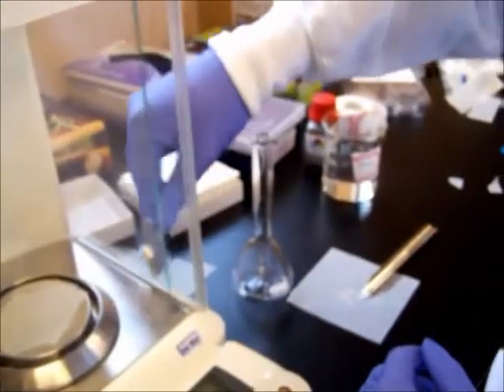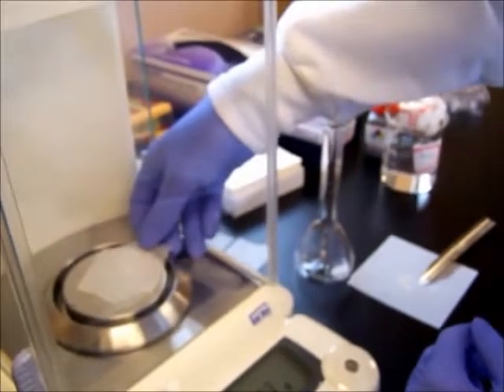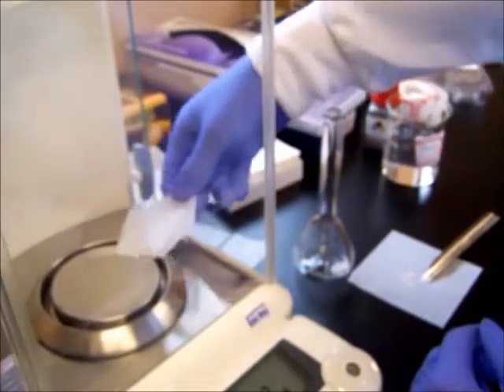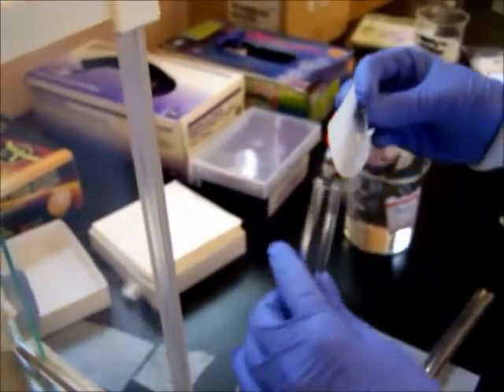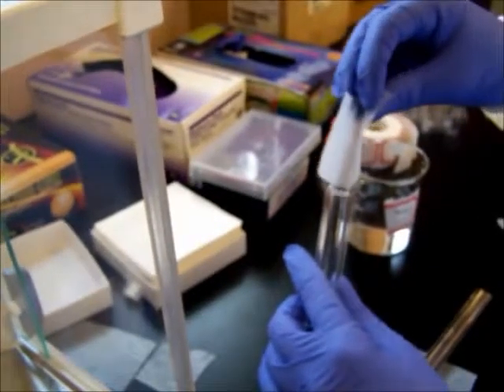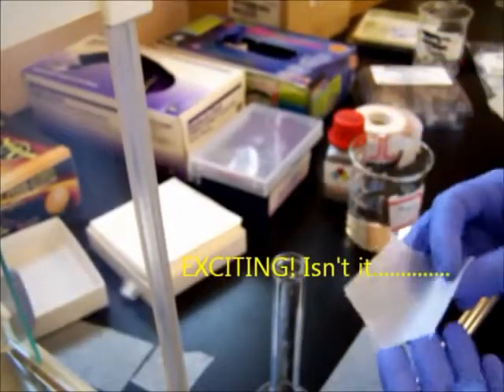and this is where it gets tricky. Get as much of it as possible into the volumetric flask.